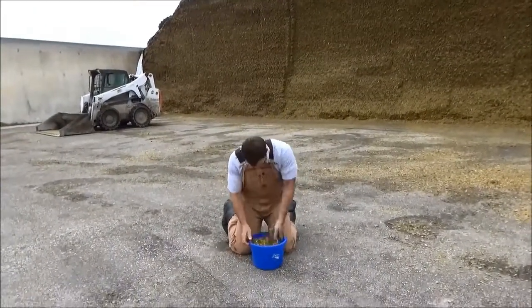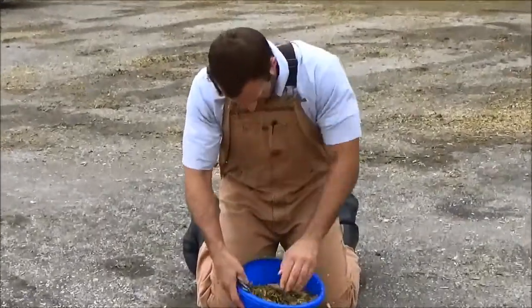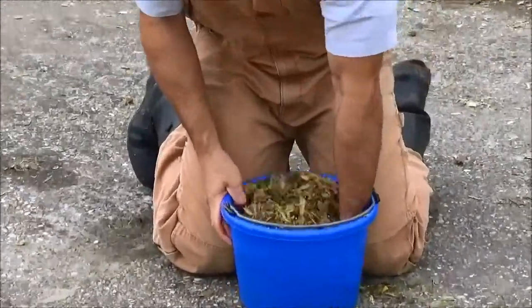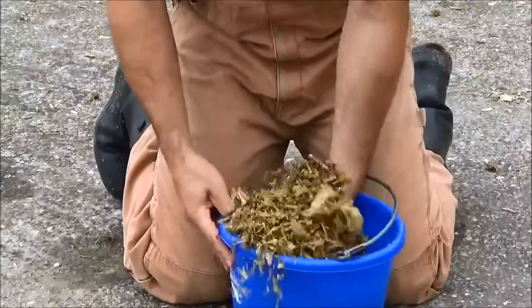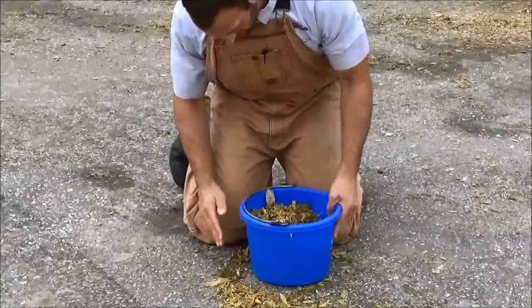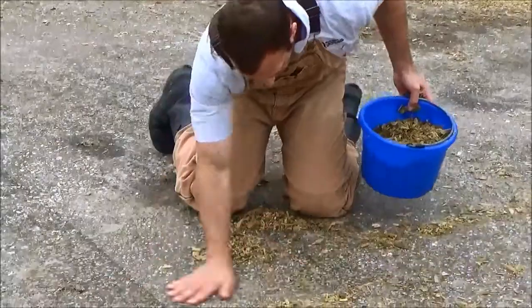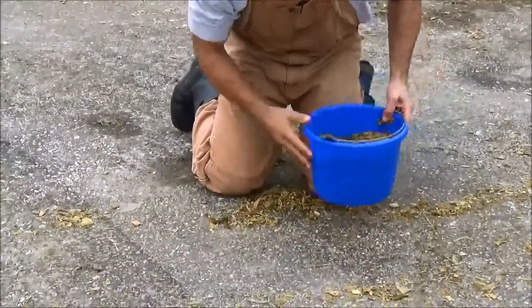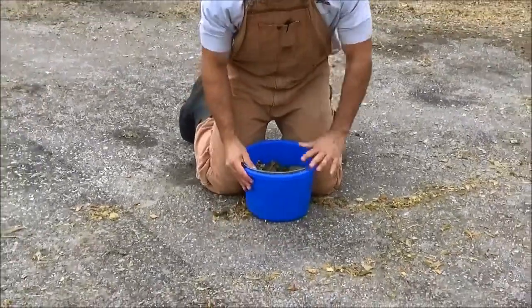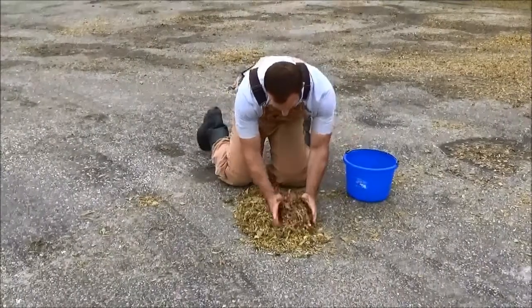Don't be afraid to get dirty. Dig all the way down to the bottom, turning the fines back over using a dumping technique — just like your TMR mixer does. You can see I'm spilling some out; that's just fine. I want to make sure we work on a flat, clean area. Ideally you may have some plastic, or some smooth blacktop or concrete like this. We're going to turn the sample over again using the mixing and quartering technique.